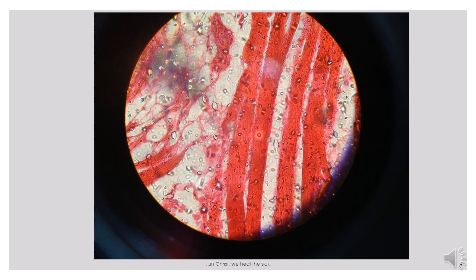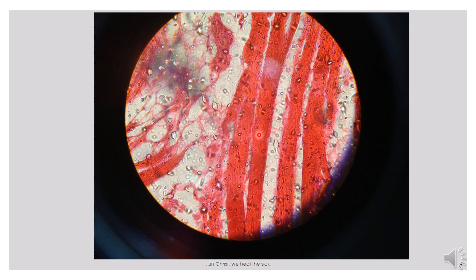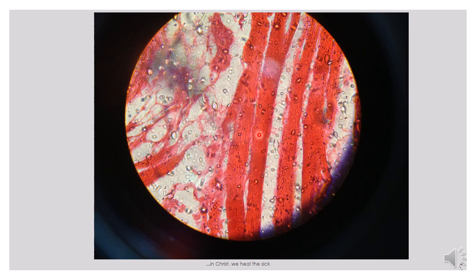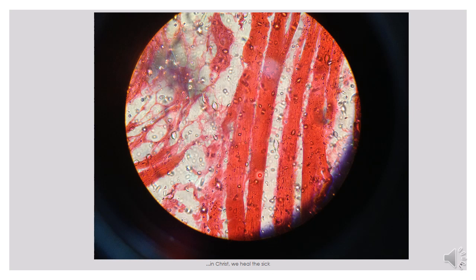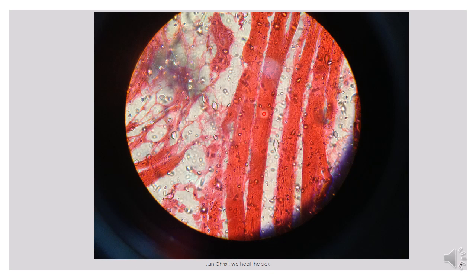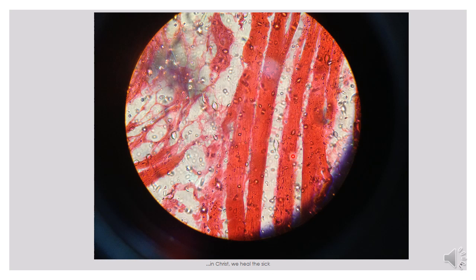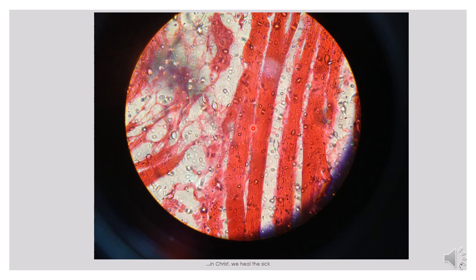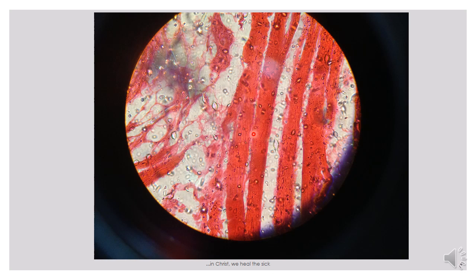One thing to note is that the muscle fibers actually arrange in parallel orientation to each other, and they are of variable length. Some of these muscle fibers can extend throughout the entire length of the muscle, while some can just be a few centimeters in length. We can also see that there are some spaces between these muscle fibers, and these spaces represent the endomysium, because what separates one muscle fiber from another is that space — the endomysium — which is a collagenous supporting tissue.